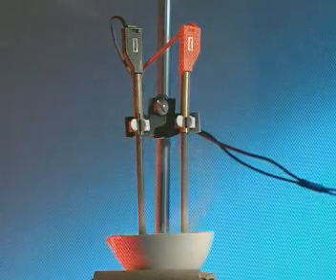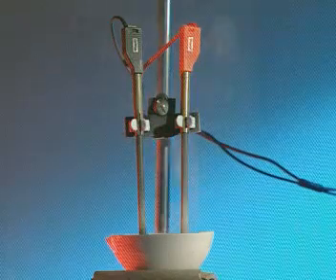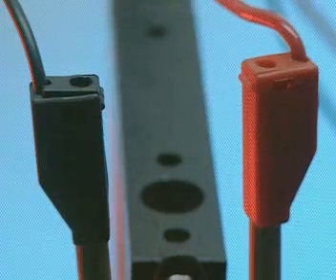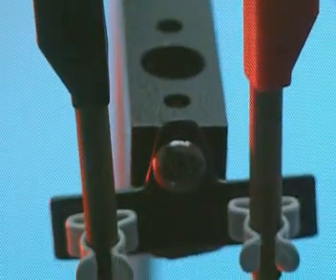In this circuit, the electrode on the right is positive. The one on the left is negative. As electricity passes through the molten lead bromide, chemical reactions start.